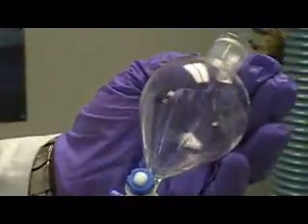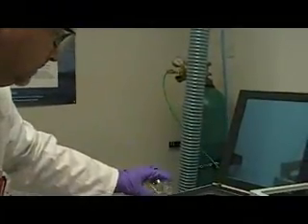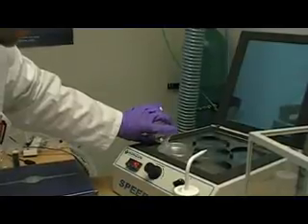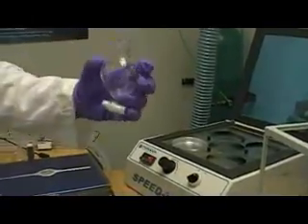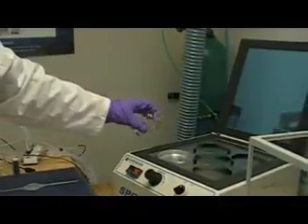So the proper pour is to get as much hexane as possible transferred, but at the same time be able to see droplets of the water that you left, the residual water. Once that is done, you should do 3 quantitative rinses of the hexane into your vessel to rinse any remaining components of interest into your container. So you just repeat that slow pour 2 more times. So that's 1. And each time you do a rinse, do a wash around the outside of the vessel. Okay. And another pour off.